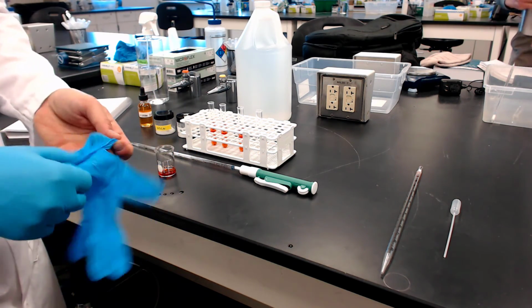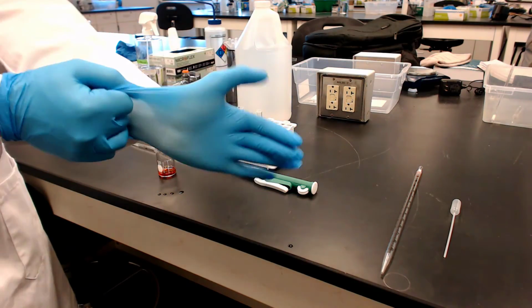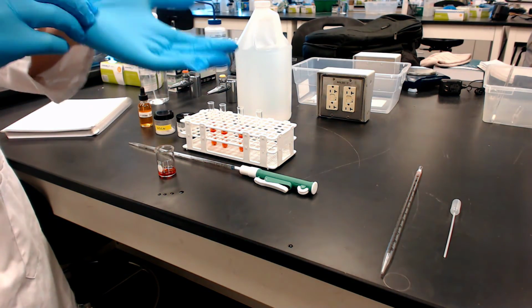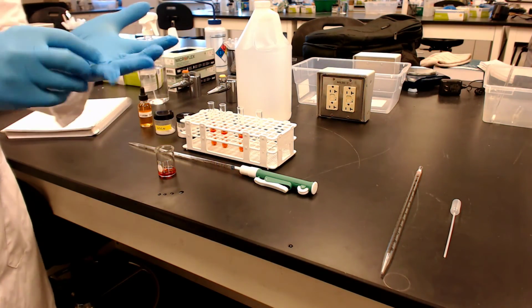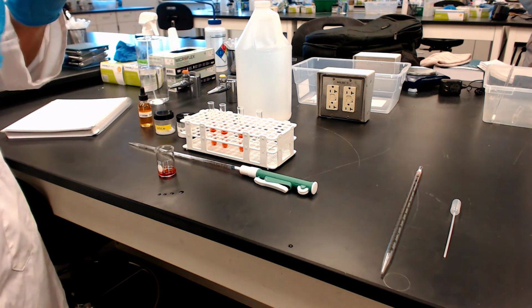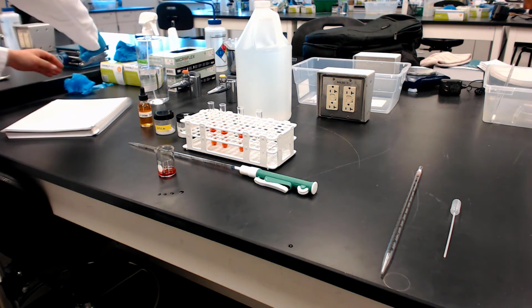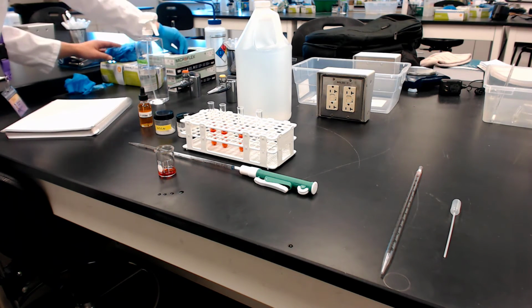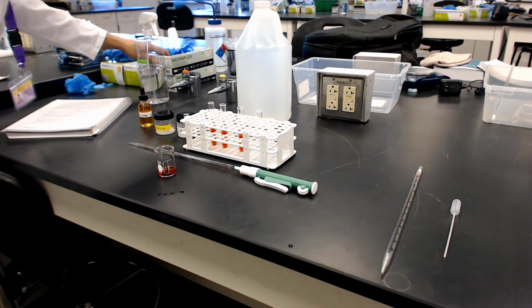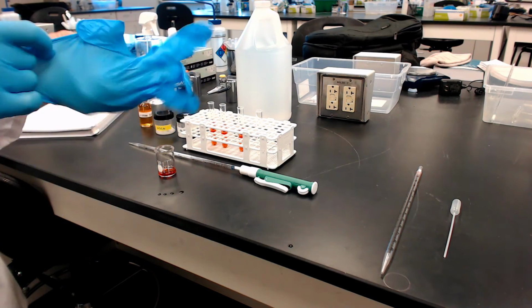This would be a good safety question I might ask you about whenever you're dispensing any chemicals. It's always safer to go ahead and use these gloves. We have them available for you. They come in all sizes, so you want to make sure you do that. And this is good. What you saw was that one glove didn't work so well. So instead of just trying to limp along and make it work, he's going to get a new one on. That's important.